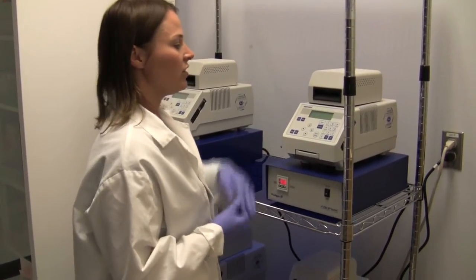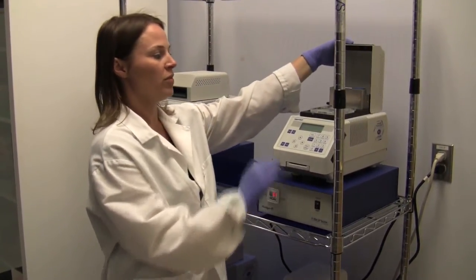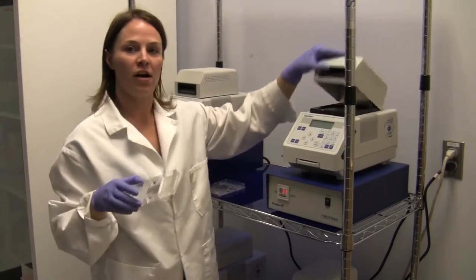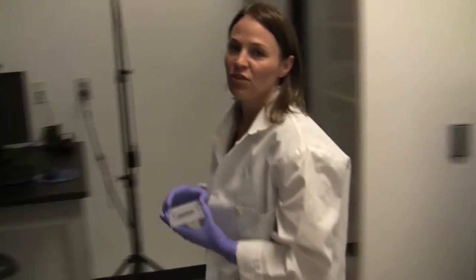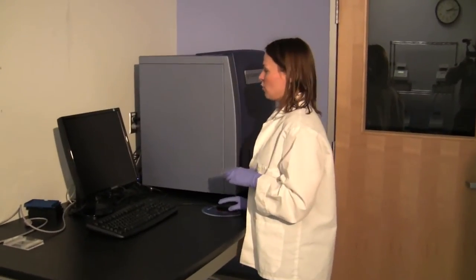So once the chip is finished thermocycling, I'll just turn off the vacuum, open the lid, take the chip off, and then take it over to the EP1 reader, which is where we will read the fluorescence data that was generated in the thermocycling process.